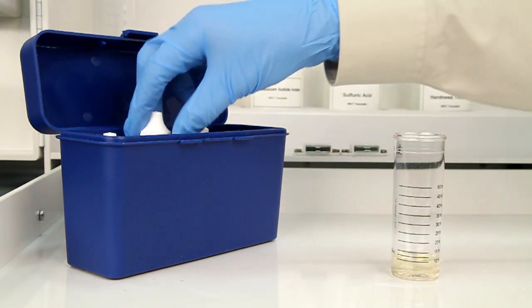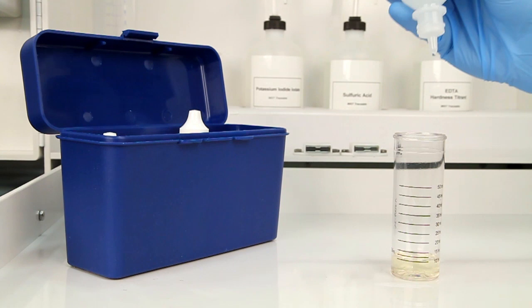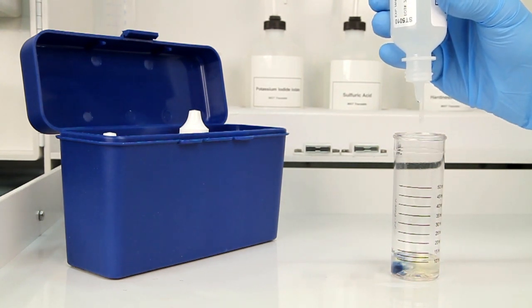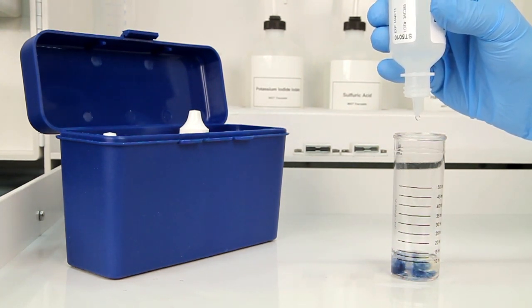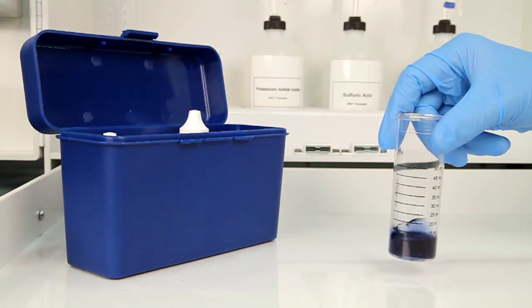The next step is to add five drops of starch indicator solution 1%. The bottle contains a dropper tip, so it's important to hold the bottle vertically to get a consistent drop size. After the addition of each reagent, swirl the vial to make sure the sample is properly mixed.